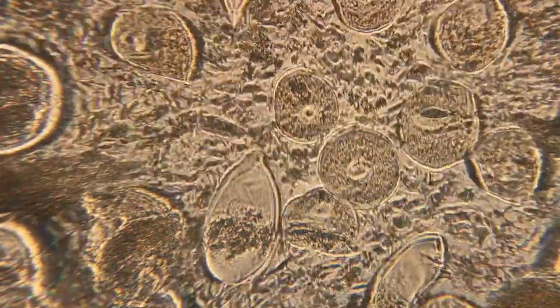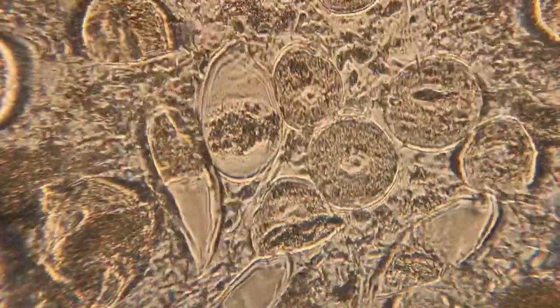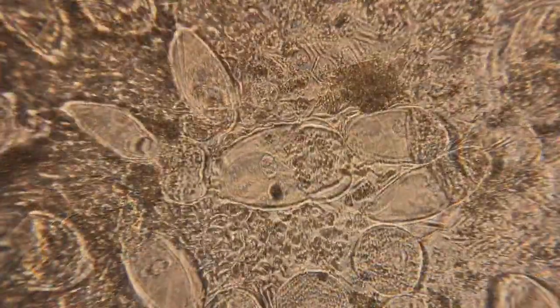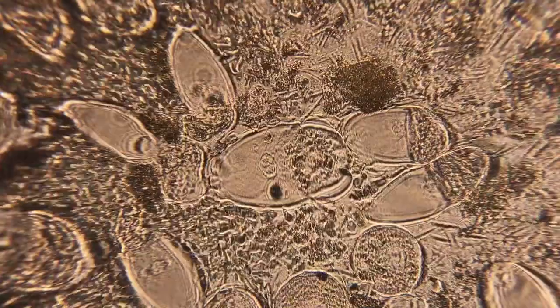You can use liquid samples by putting a drop of liquid between two cover glasses and a little bit of wax to hold it apart. This sample shows the protists that live inside the gut of a termite.